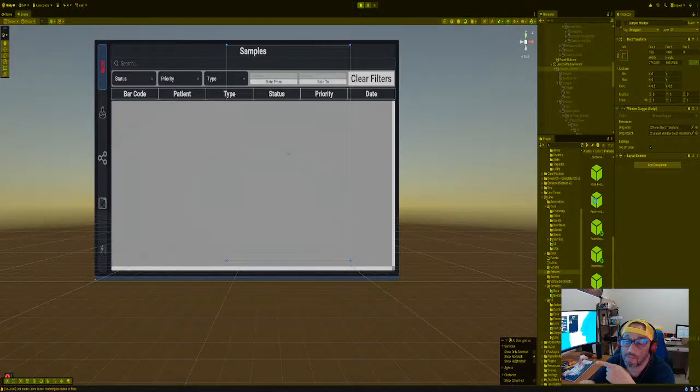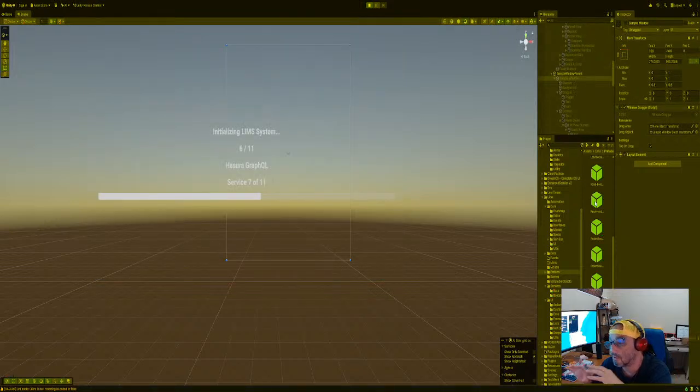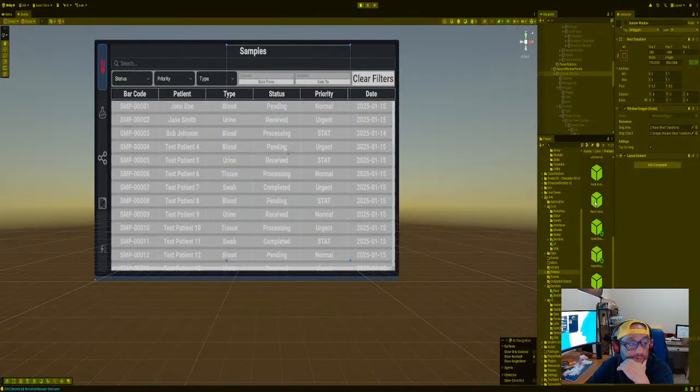So we need to add a quick menu somewhere on there, just because it's easier. The tech lab guys are going to want a quick menu if they don't want to dig deep for all these deep-seated menu items. It's kind of ridiculous. So okay, here we are.